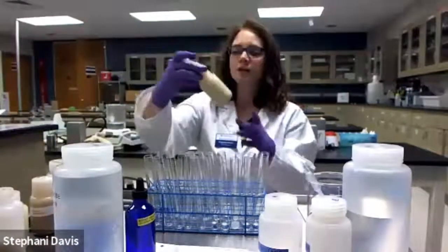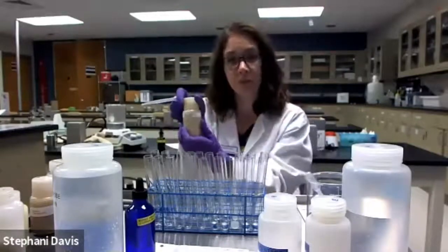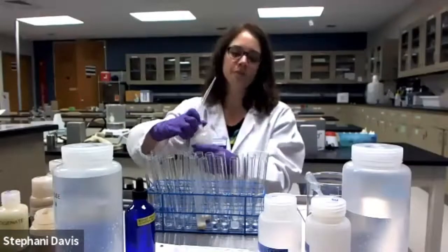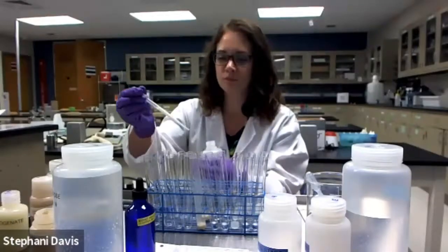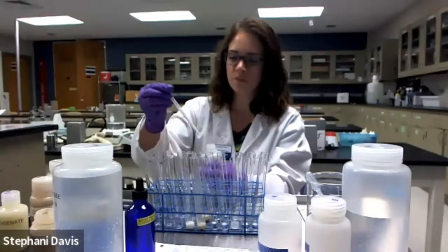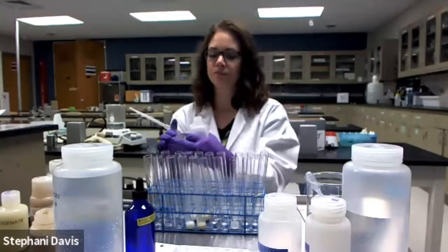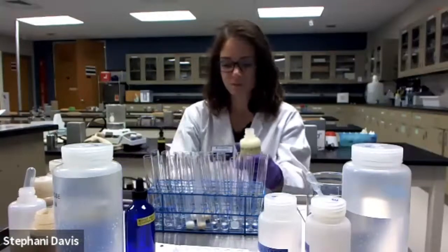All right, so next I'm going to get into some food items that we'll test. First, I have peanut butter homogenate. All right, so that's number 6. Number 7, we're going to test milk. Number 8, I have onion homogenate.